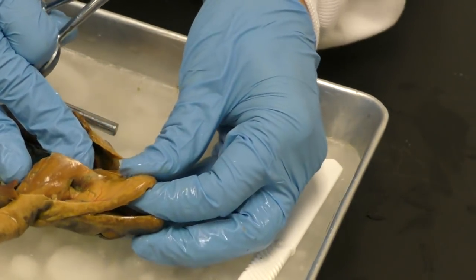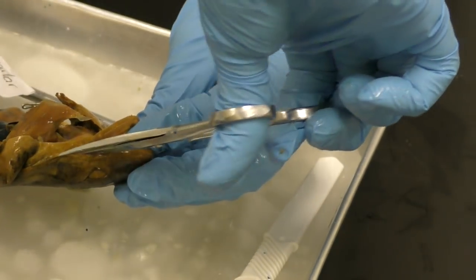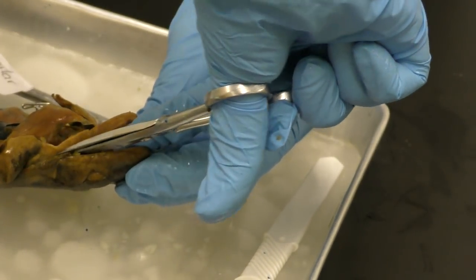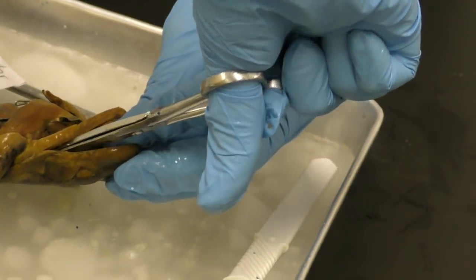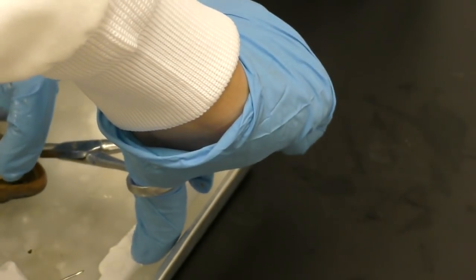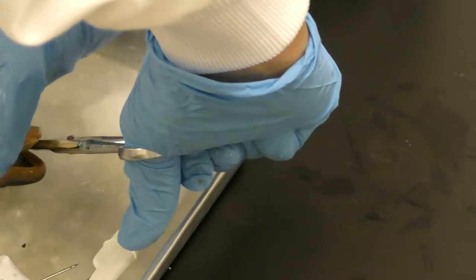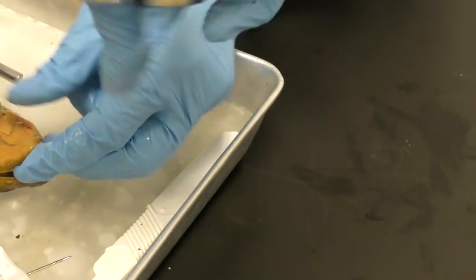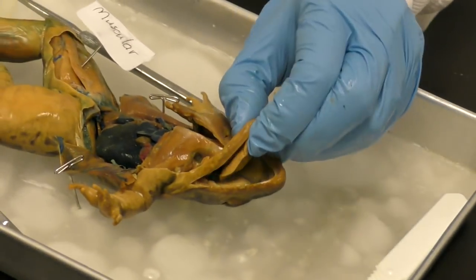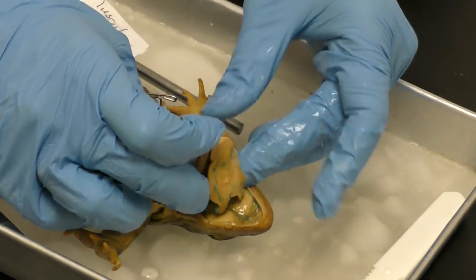And in order to do that, when we're dissecting, there's a level of respect for the creature, but then also, you know, realize that it's here to teach us. So I'm not hurting it. It's already passed. It's preserved and ready for me to show you its parts.